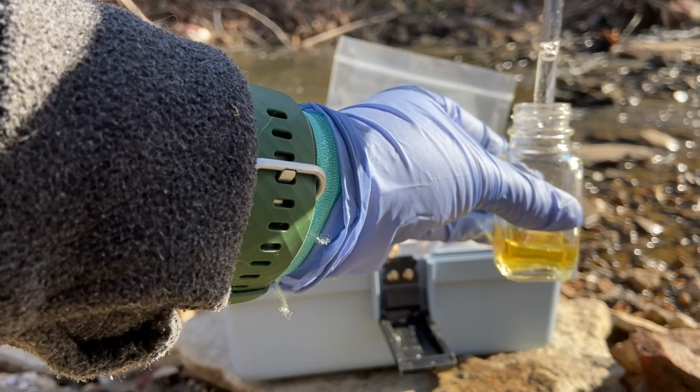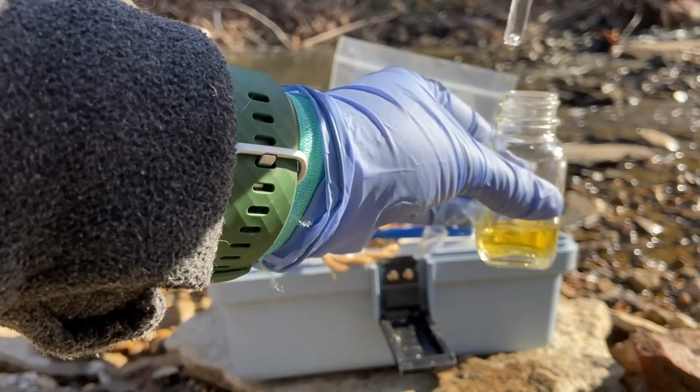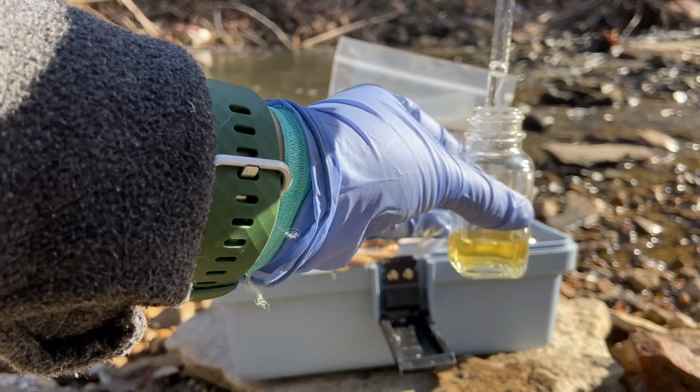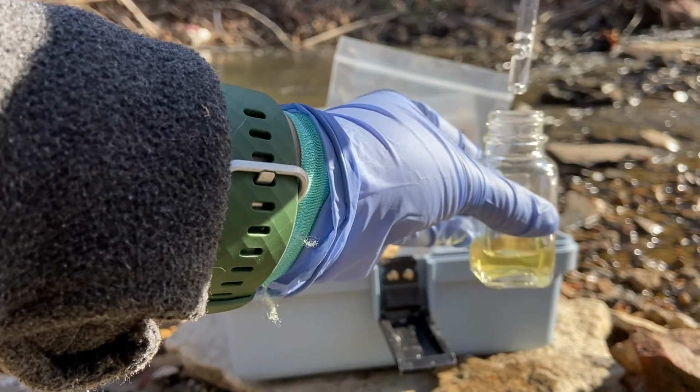Make sure you are giving full, confident squeezes of the dropper. Then fully release the dropper between drops. It's possible to get smaller drops when the monitor is apprehensive with the dropper and if the dropper is held improperly. This results in a measurement that is too high.